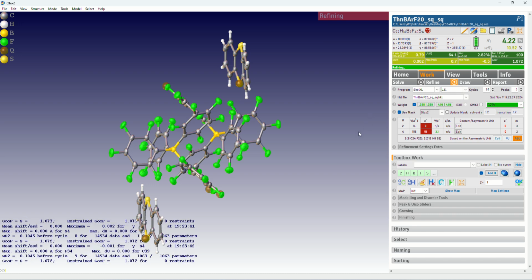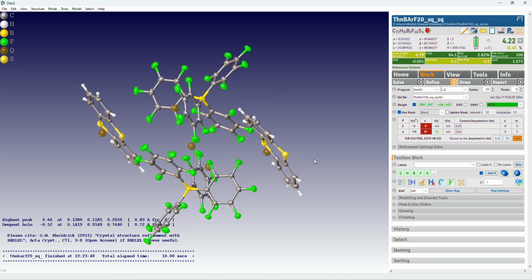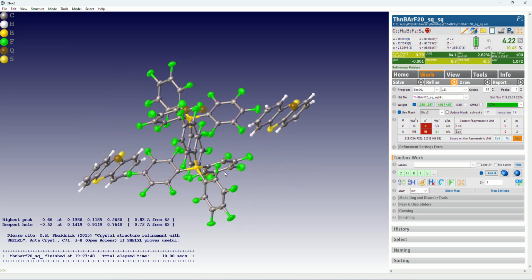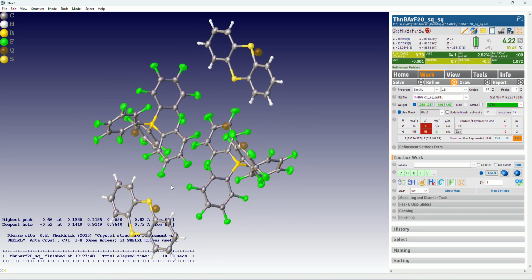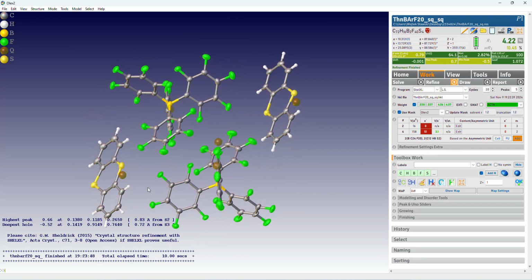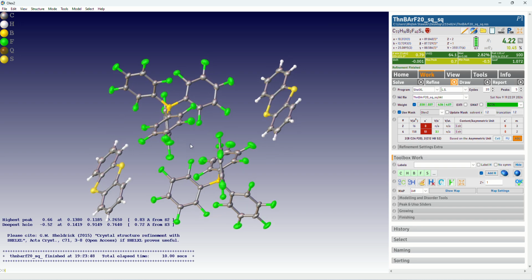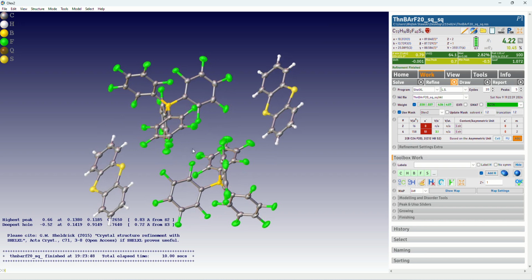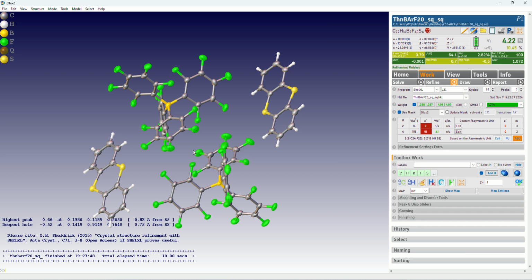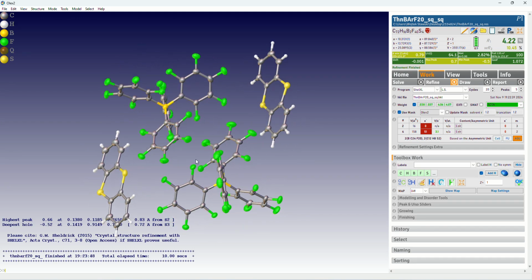So that's basically how it works. And again, I would advise to write in the CIF file also separately that we used solvent masking. And it should also be indicated somewhere, for example, in the supporting information file where we describe how you dealt with the crystal structure, because if someone is not a crystallographer, it might be difficult for that person to find that information in the CIF file. But if you just put it in the supporting information or also in the main text that you had to use solvent masking, then it's all legit and fine.